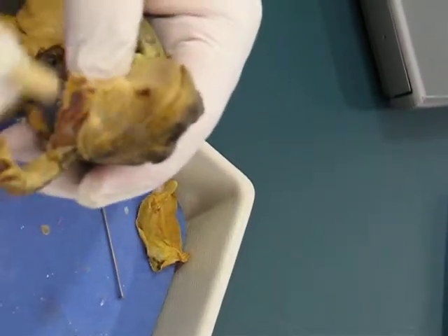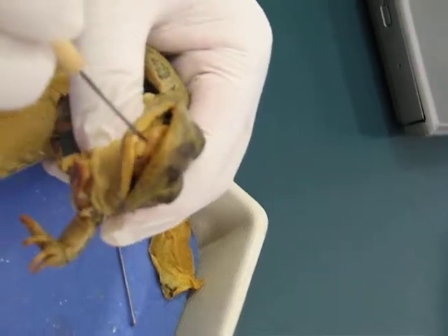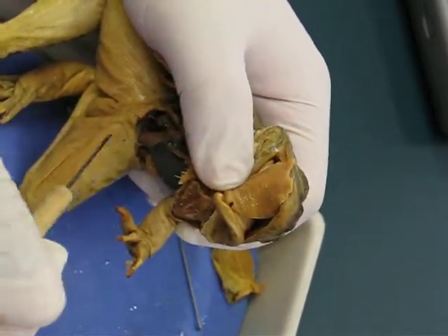The tongue is inside the mouth, although we never make you look at it, we do have questions about it. What you can see is it's actually attached in the front instead of the back — weird.